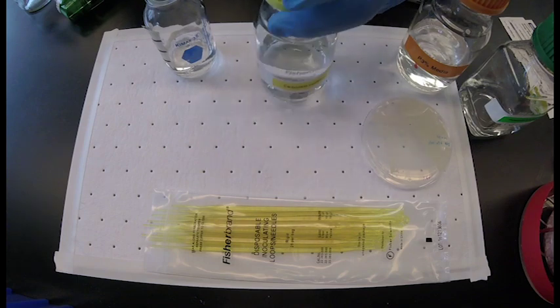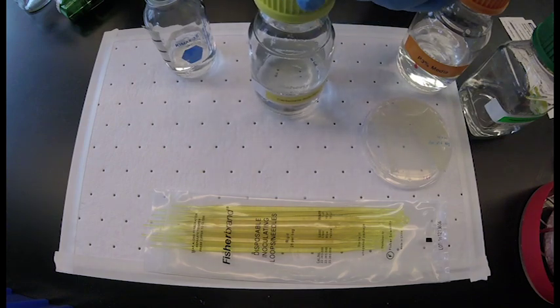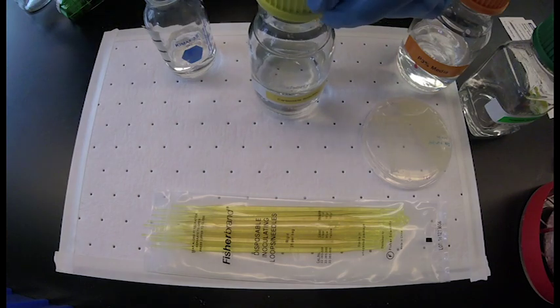And there is one milliliter of carbonate solution per 25 milliliters of P3%.